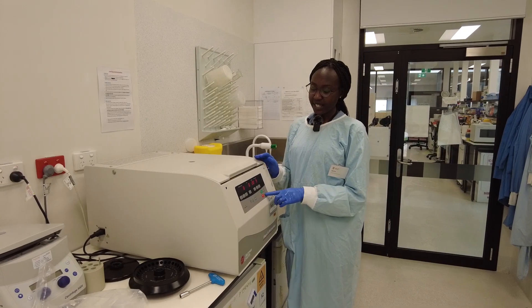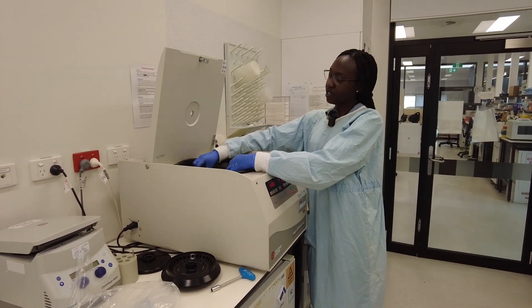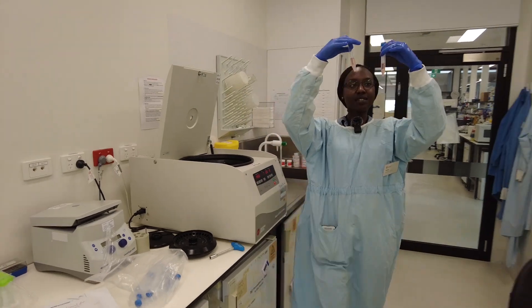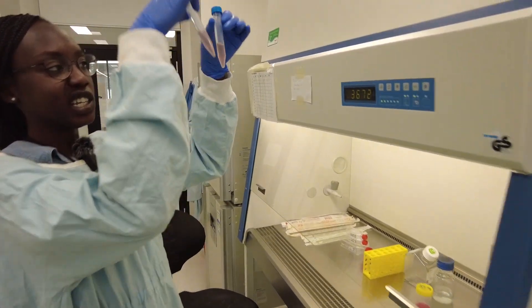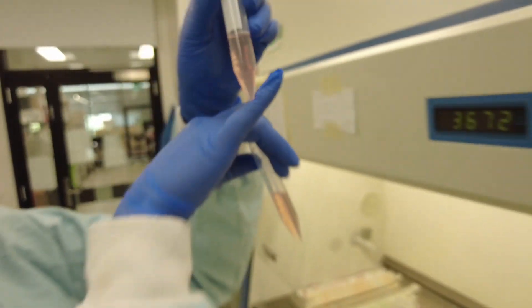So 7 minutes has elapsed. So now we're going to collect our centrifuge tubes and we're going to split the cells. So the cells are a small pellet at the bottom there in each tube. Very small.